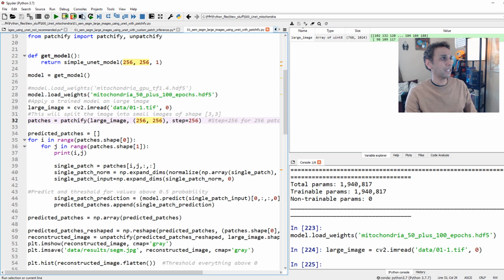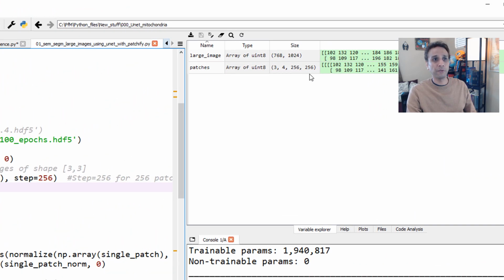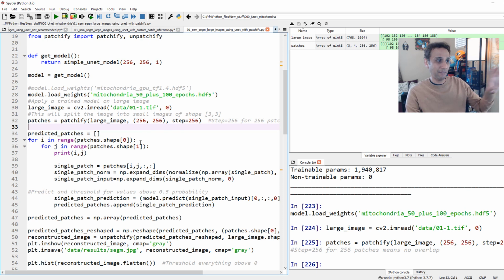So when I do this patchify, and if you look up here, it says 3 by 4 by 256 by 256, right? This is exactly right. 768 by 256 is 3, right? And 4, so there are 12 of these total. Now I still need to write my for loop to go through each one of these patches and apply this. So all it's doing is just separating patches, so I don't have to write my own segmented image with zeros and then fill these with zeros. That's what you're saving here. And I believe Patchify also works on 3-dimensional images, so I'll let you explore that.